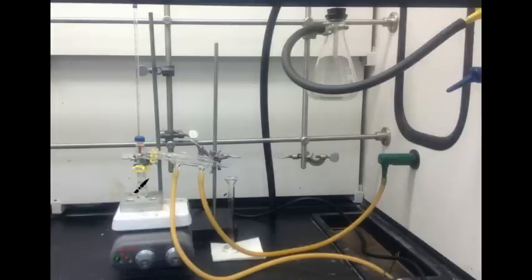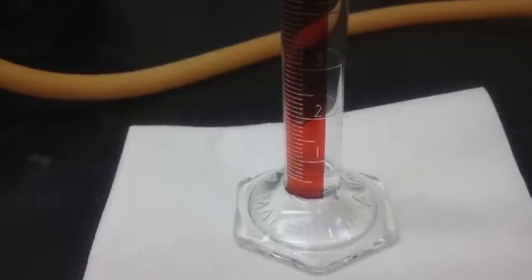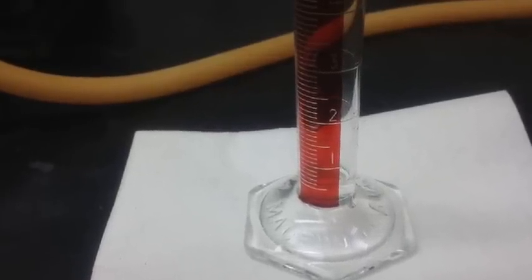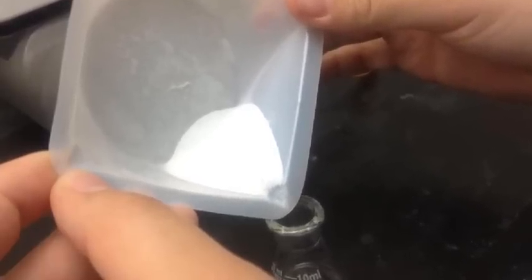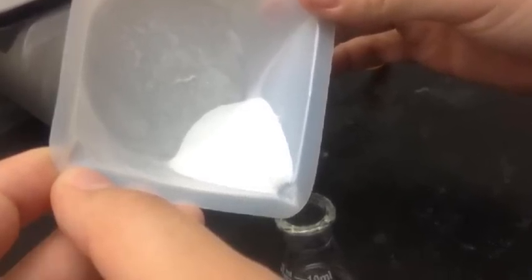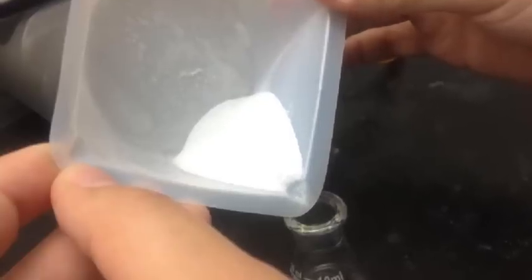As the contents evaporate, they become liquefied in the condenser as they cool, and we have to collect 0.5 to 0.7 milliliter of distillate. This is a picture of 0.5 milliliter of distillate collected. This product is dried using anhydrous sodium sulfate, which in this case means without water.